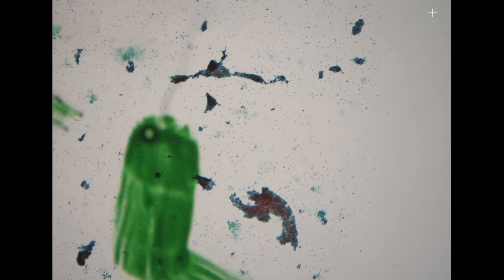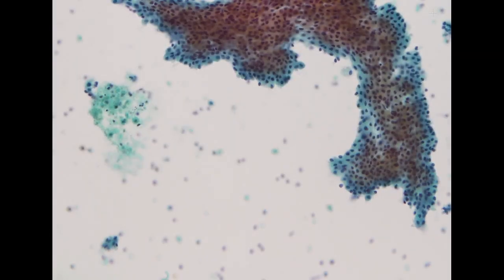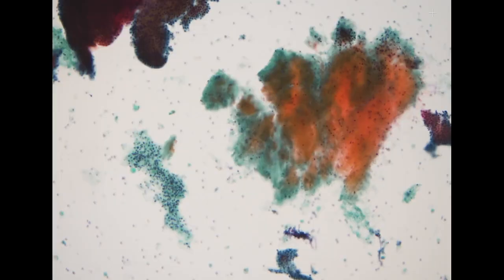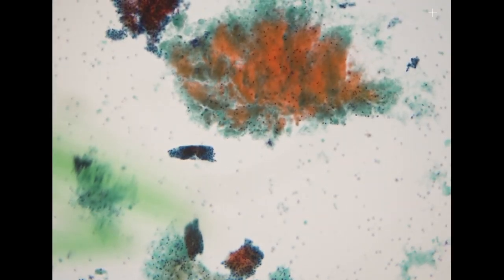The next specimen is also from parotid. It's a 60-year-old male who smoked one pack of cigarettes for more than 40 years. On low power, you see large fragments of oncocytic epithelium with nice honeycombing arrangement. And in the background, you can see some degenerative debris and inflammatory cells. This is very typical for a Warthin tumor. And we have a lot of epithelium this time. It is not very common to see this many fragments of oncocytes. So we see degenerative debris, we see oncocytes, we see inflammatory background. This is a typical case for Warthin tumor.